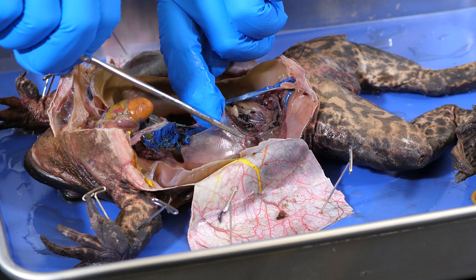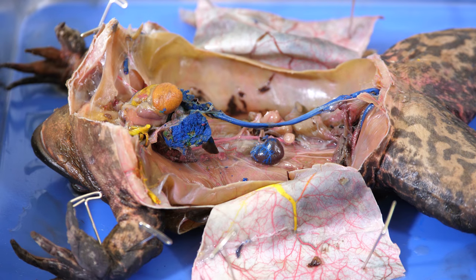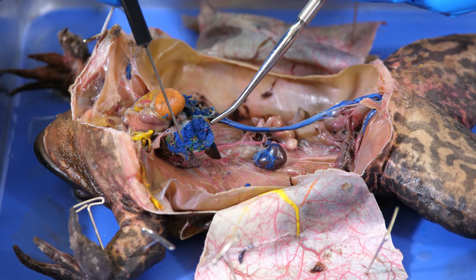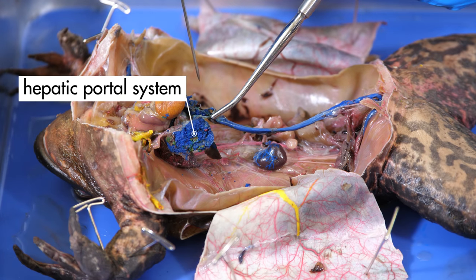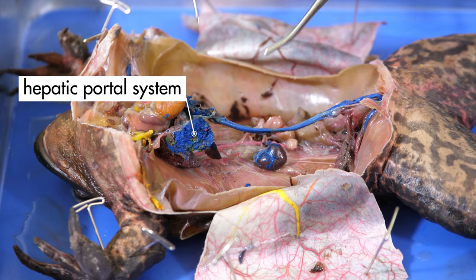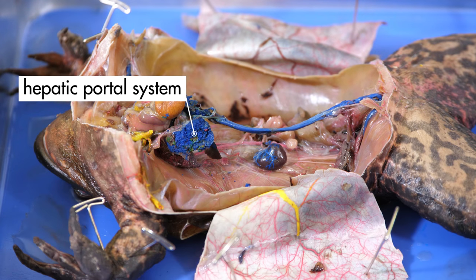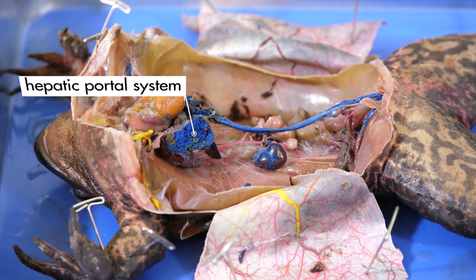Now, we can remove the large intestines and more of the mesentery. With the liver removed, we can see a large group of arteries and veins just posterior to the heart. This is the hepatic portal system. All of the frog's blood flows into and out of the liver through the hepatic portal system, so toxins can be removed as blood flows through the liver.